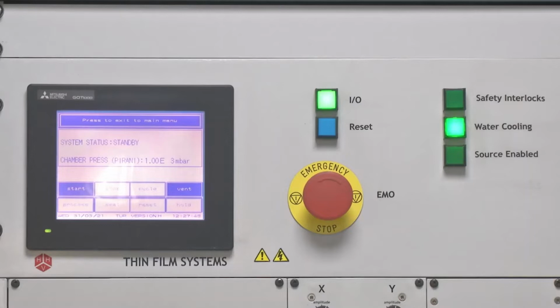Also, among the display buttons that you can see, which are a total of 8 of them, only 2 display buttons are highlighted, either start or vent. So these are the only 2 operations we can do. However, we have already vented the chamber. We have gone through all the sequence of venting the chamber, taking the chuck out, loading the sample on the chuck and then loading the chuck along with the samples. Now the next step will be to start pumping. So let us see the next sequence of pumping.